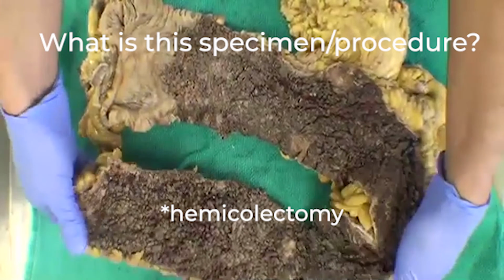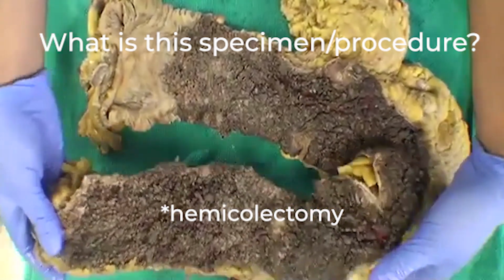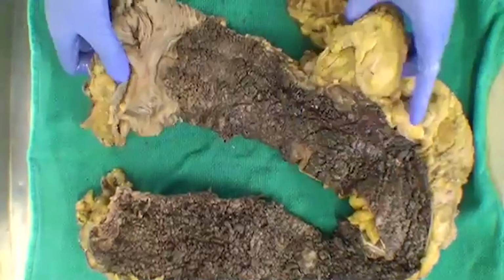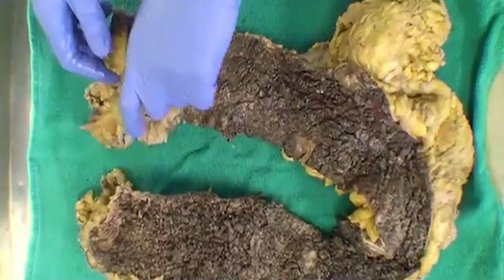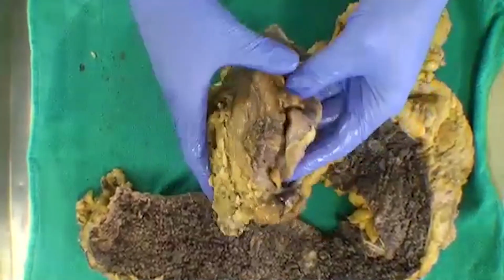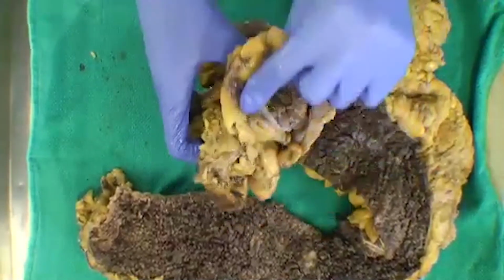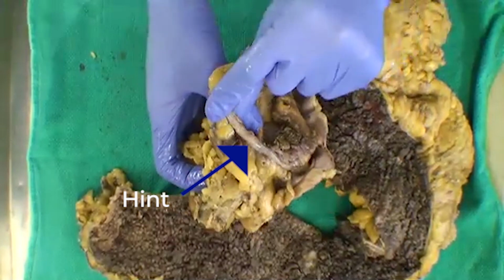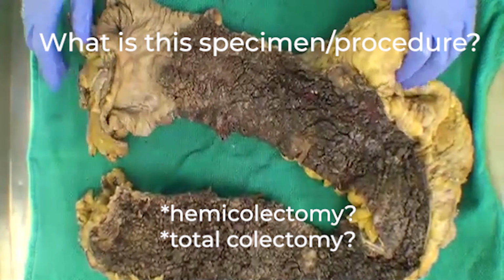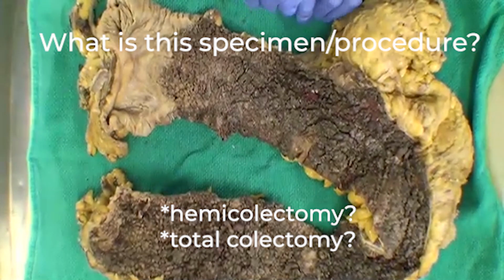Okay, so we have a hemicolectomy, a thought there, okay. Could it maybe be more than that? Another person says total. Yeah, so this one could be close to a total colectomy.